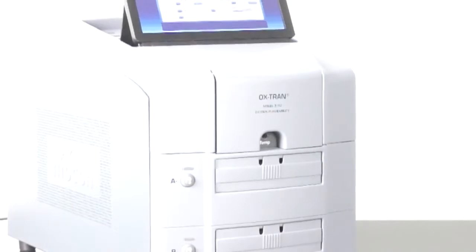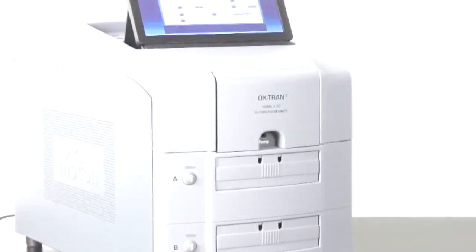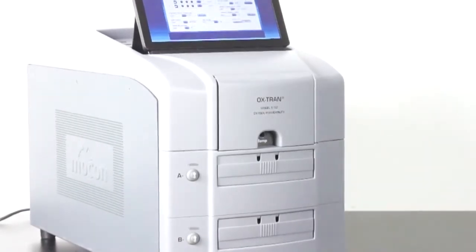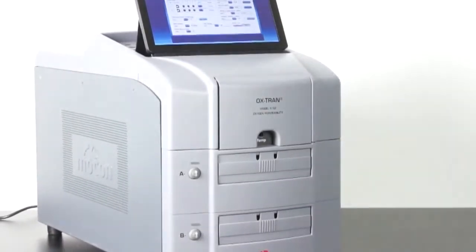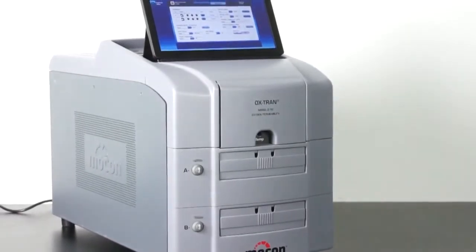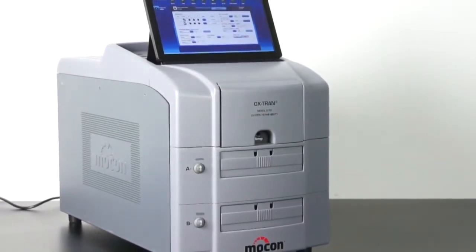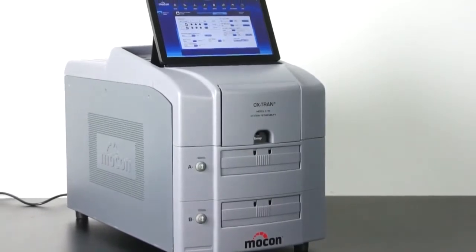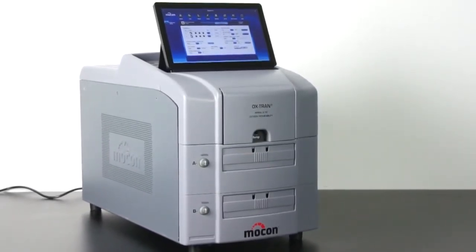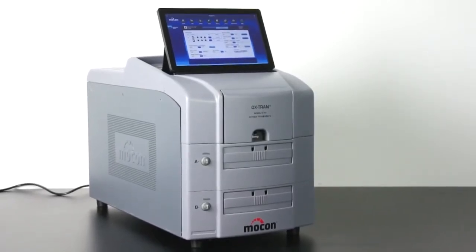In addition to the touchscreen, you'll be able to connect a keyboard and mouse via the USB port should you prefer that style of access. Ethernet-ready capabilities enable you to connect this instrument to your corporate network and use the optional PermNet Lite software. An operator can view and operate the instrument from any computer on the network exactly the same way as if they were standing at the instrument.